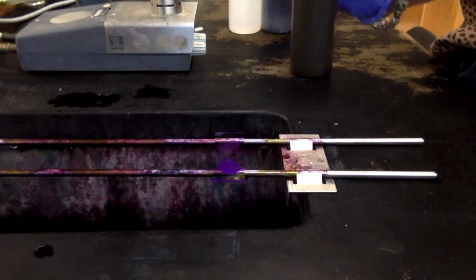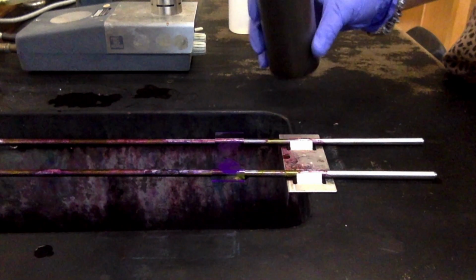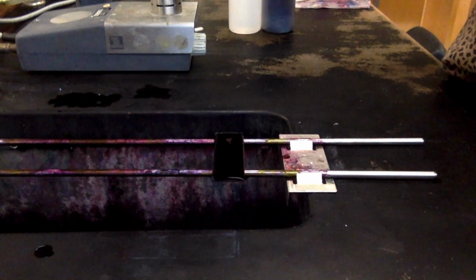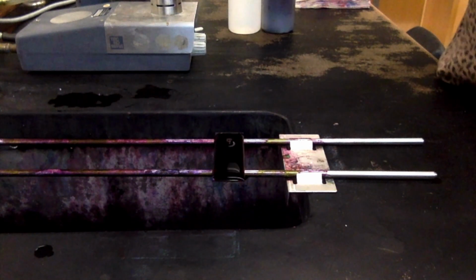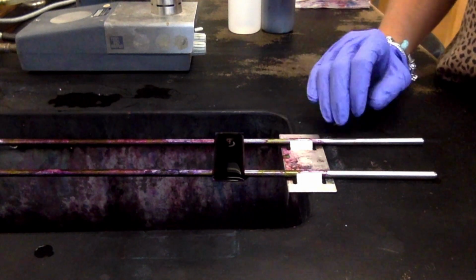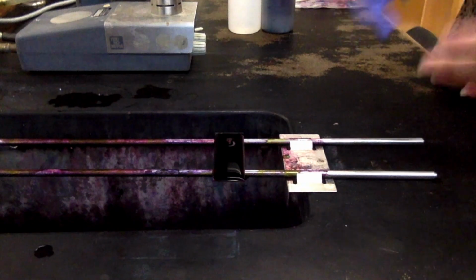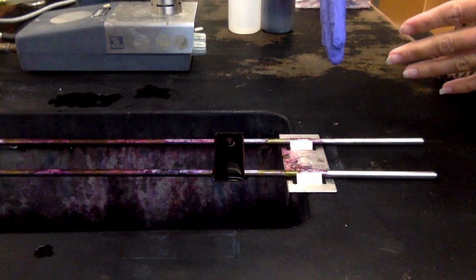Alright, so now we are going to move on to the mordant step. I've already rinsed my crystal violet off, and now I'm going to apply the mordant, which is iodine. And you treat it just like if it were a dye. You're going to flood the entire slide, and we are going to let it sit for a minute. Now, after this step, when you rinse, you don't want to rinse a whole lot, because you might potentially rinse some of the color out, and we don't want that to happen yet.